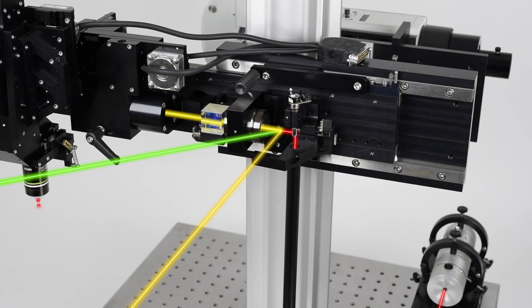This allows the added beams to be completely independent of the scanner system while still utilizing the scan lens and tube lens pair to project the photomanipulation beam spot on the sample. This allows for a simple setup using pre-aligned or manually controlled stimulation points within the field of view for easily implementable single-cell stimulation.